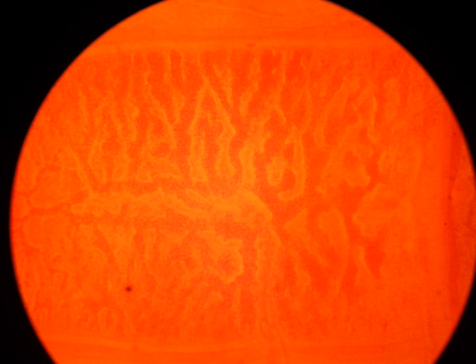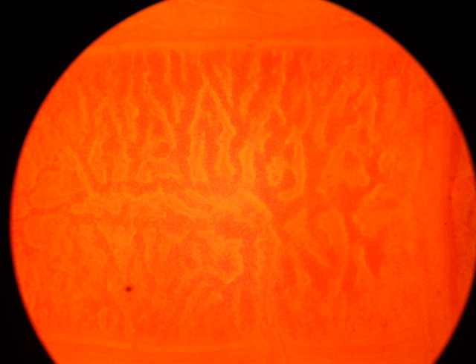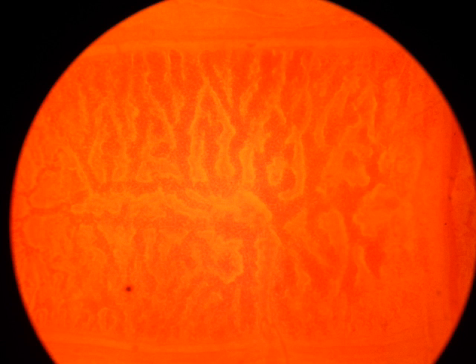As the proglottids move towards the distal terminus of the tapeworm, the proglottid becomes largely a sac containing embryos in branches of the uterus.